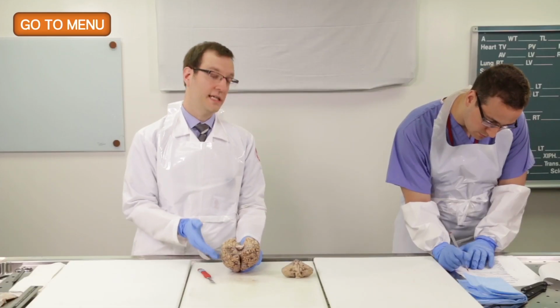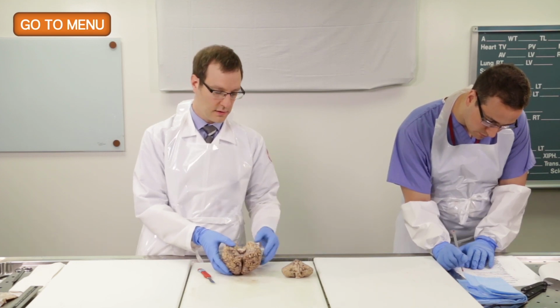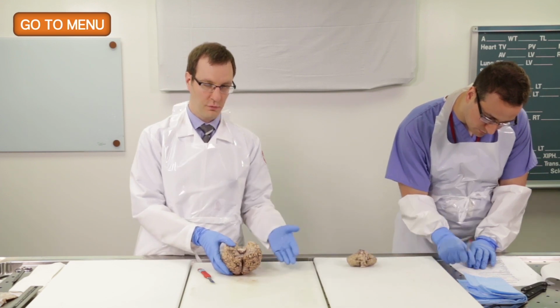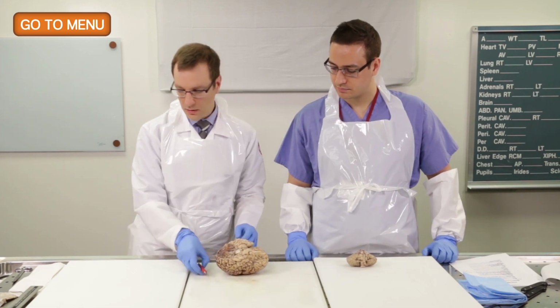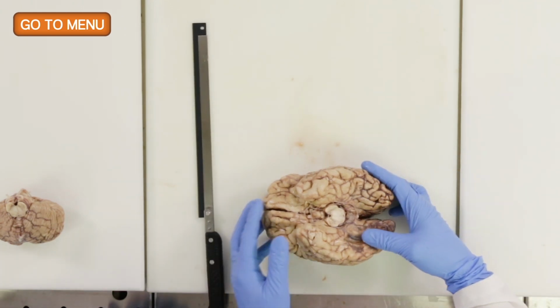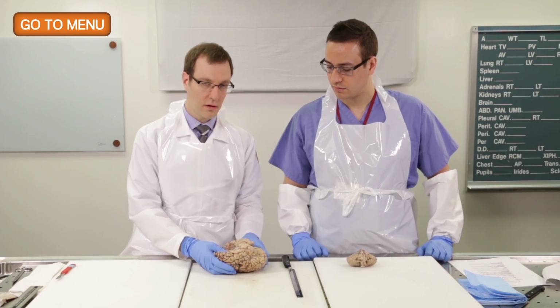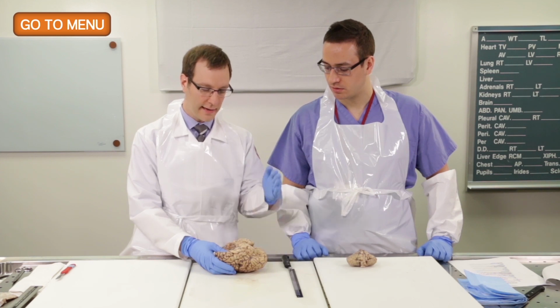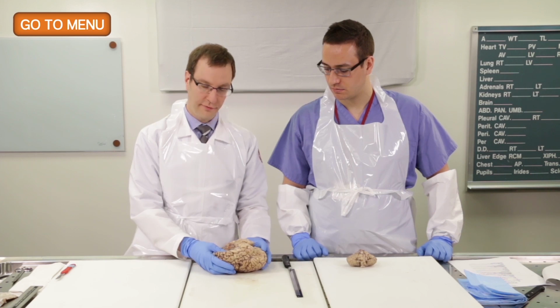So again, it's important to keep looking at the brain as we go through all these steps, because you may discover things which you couldn't see before. So we'll put the cerebellum aside for now and the brainstem, and we'll proceed to cut coronal sections of the brain. So it's important to use a sharp knife for this, obviously, and I like to do this by hand. Other residents and other attendings may use a cutting board device that guides the knife at different intervals, but I like to do this freehand.